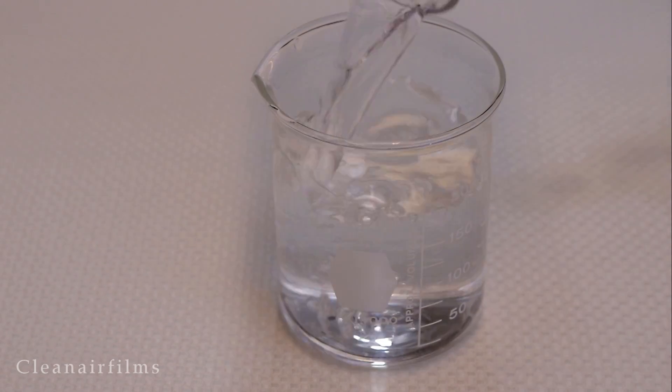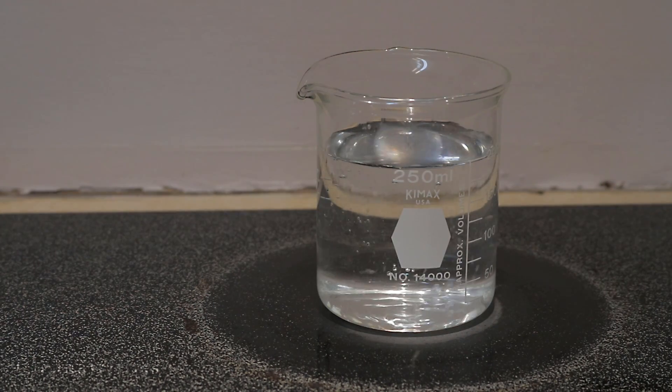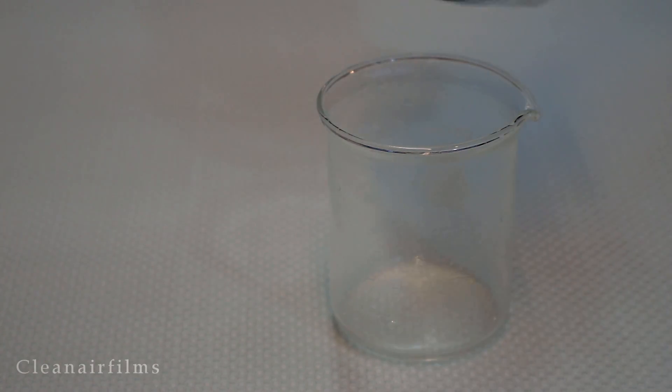Let's start by boiling some water in a beaker. In a second beaker, add ice and water.